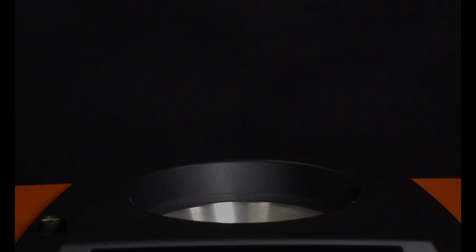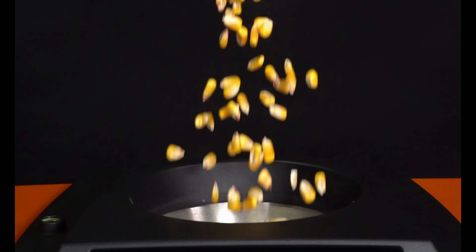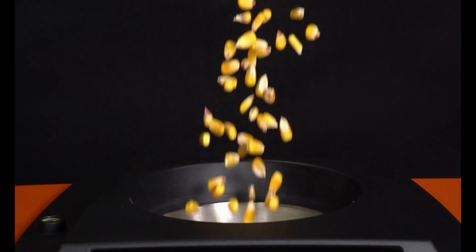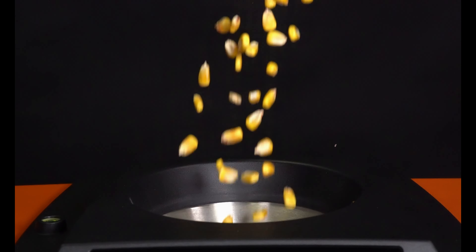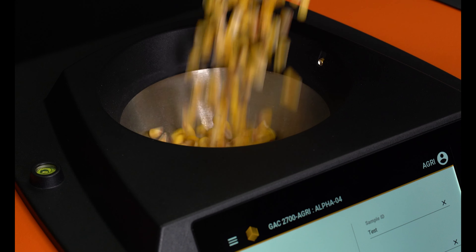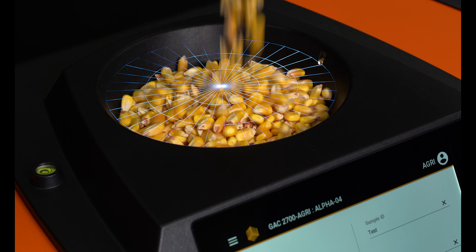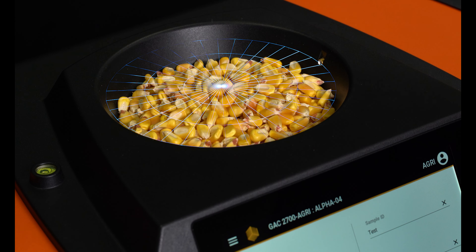Pour the sample grain into the upper hopper. There are sensors on both sides of the hopper that will sense when the hopper has enough grain. This eliminates the need to weigh the sample.